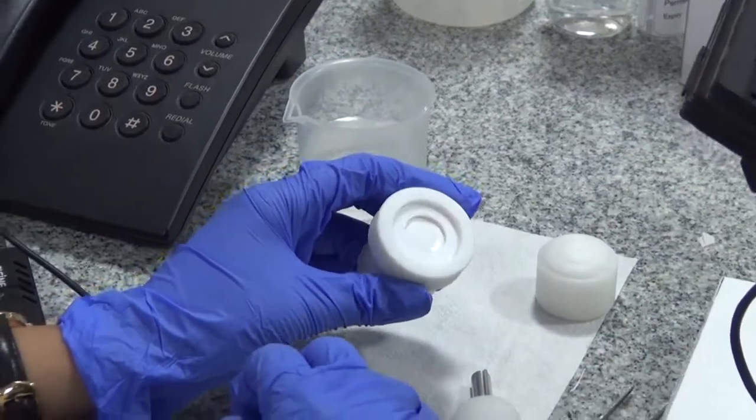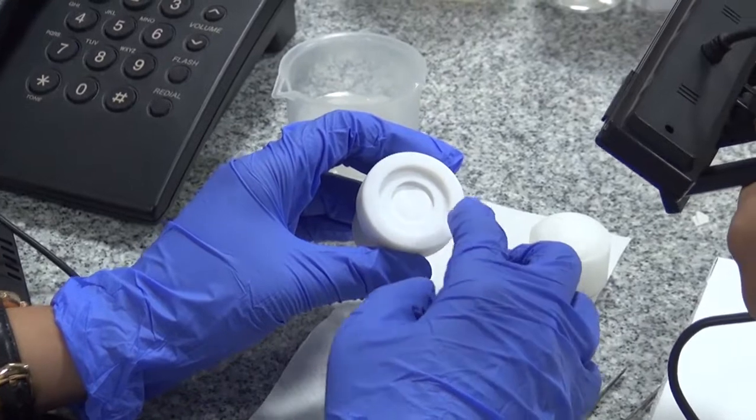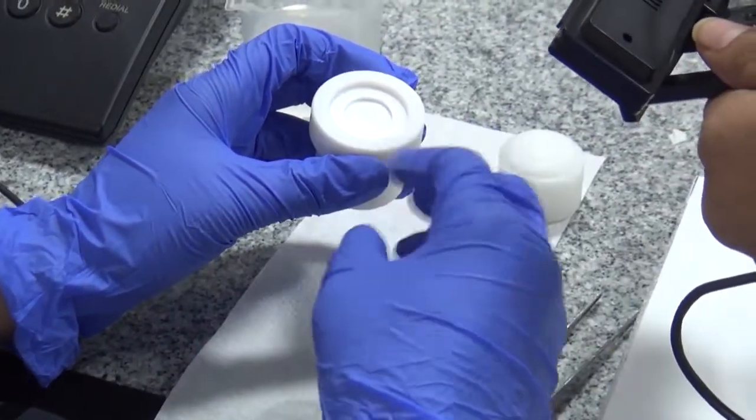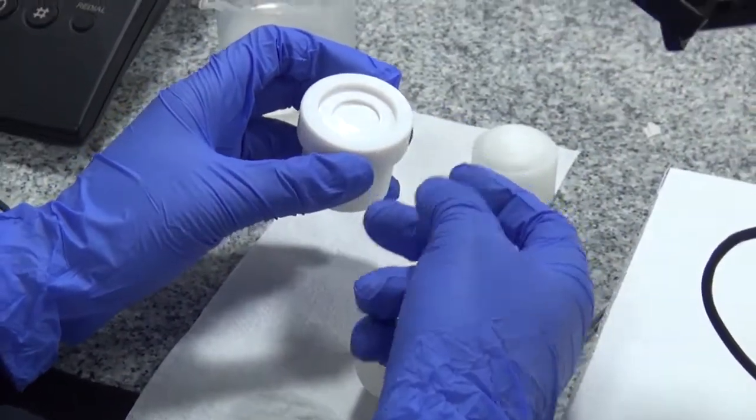You can see the membrane is at the center of the immersion cell. In a similar fashion, we will prepare all six immersion cells.